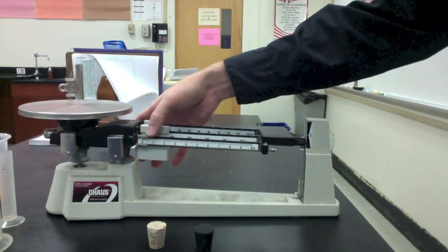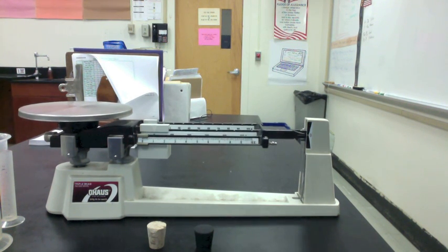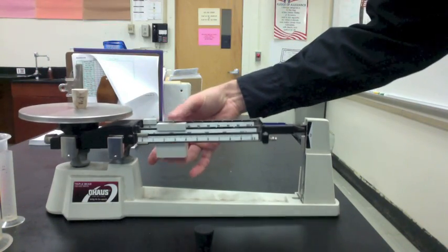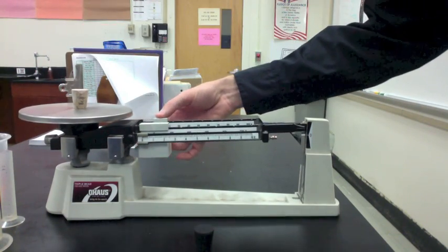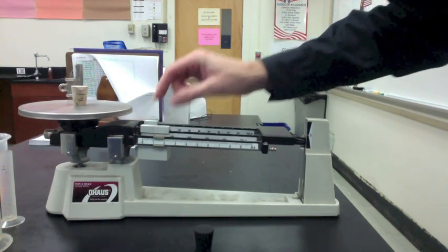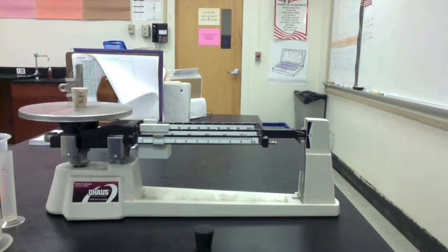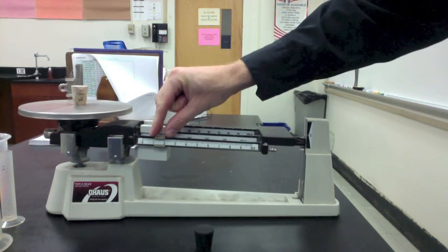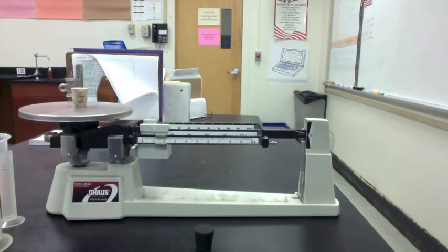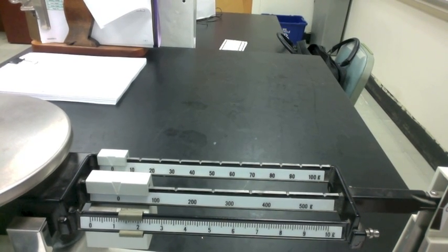We can now repeat the process for the cork. Zero out the scale. Put the cork in the center of the pan. Move the largest rider first, then the medium rider, and finally the smallest rider. With the scale in balance, add up each rider and put this value on your data table under mass for the cork.